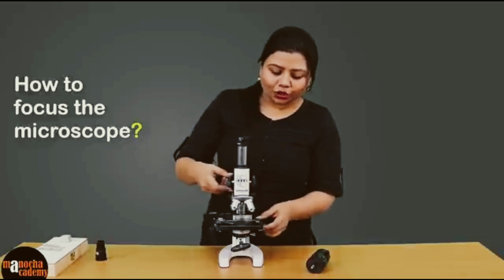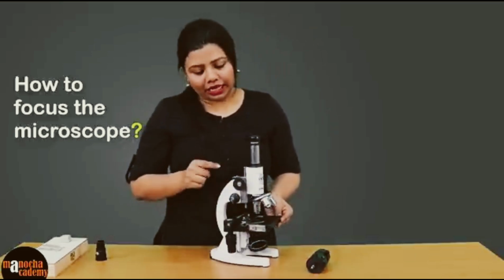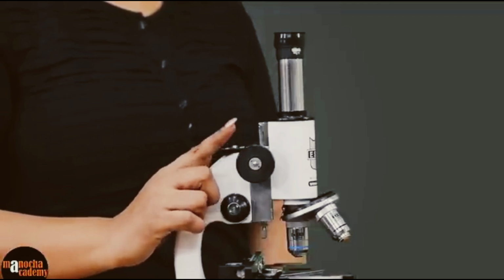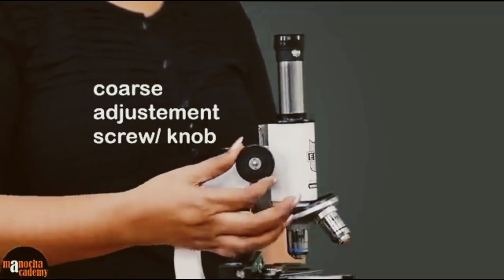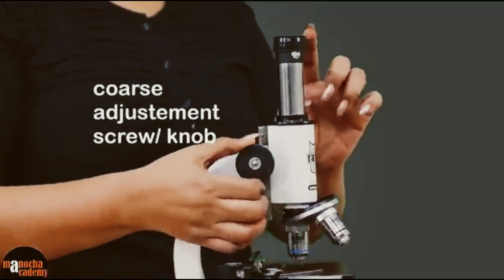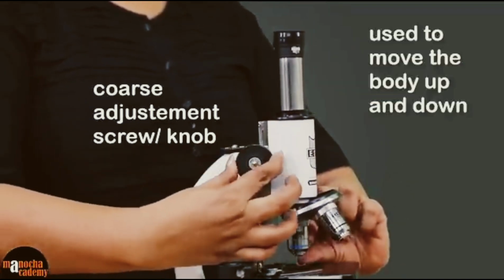All right. So how do we do that? For that we have these two screws. The first one, which is this large one, is known as the coarse adjustment screw. If you see this one, and if you just rotate this one, you can clearly see that the body is moving up and down along with the lenses.